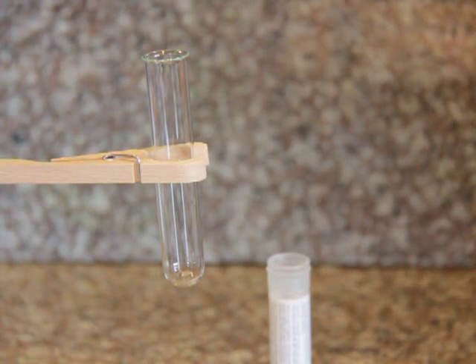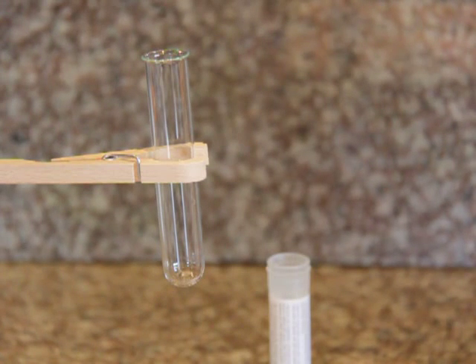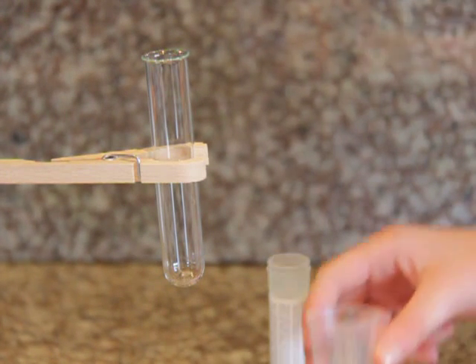To do experiment number 12, I am basically doing experiment number 11. However, I will be using a copper sulfate solution made from the copper sulfate included with the kit. To begin, I need to dissolve one spoonful of the blue crystals in 5 milliliters of water.